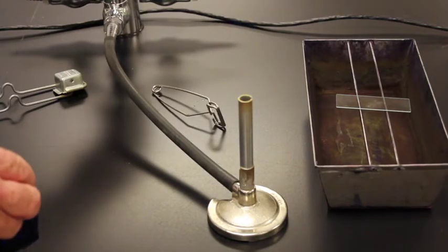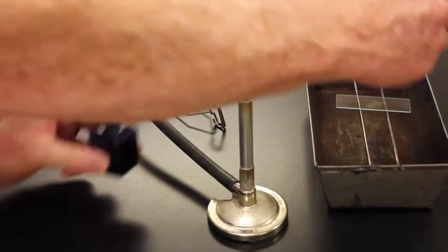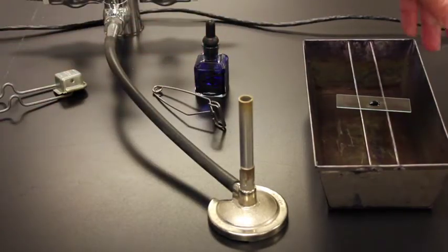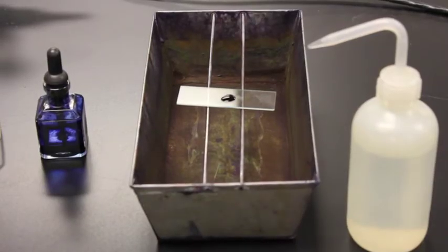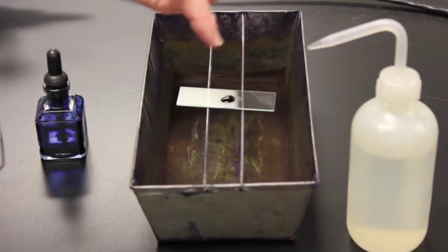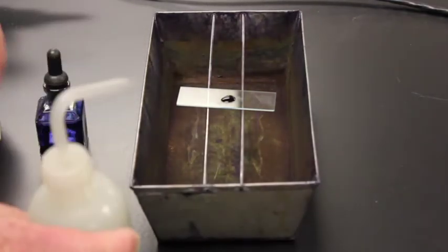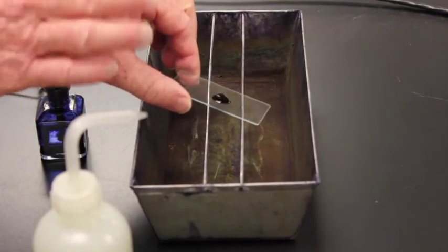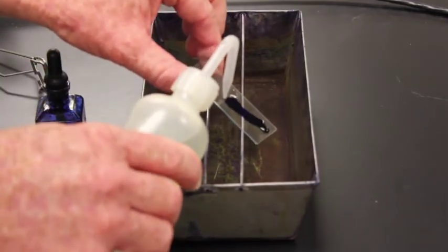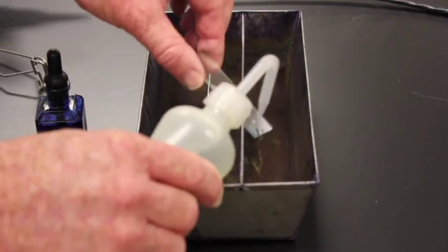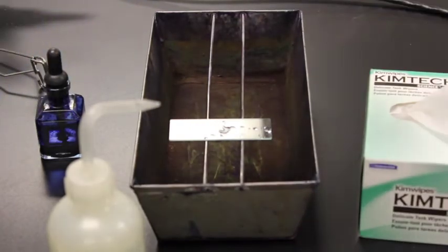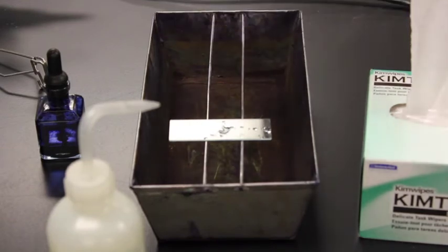After it's on the staining tray, then I'm going to turn off my Bunsen burner. I'm going to add methylene blue. So we'll put methylene blue on top of this stain. And then we will leave that methylene blue there for one minute. Now the next step in staining is simply washing it off. So we put our slide here, put our stain. It's been one minute. So I'm just going to take my wash bottle. I don't really like the clips because they're a little bit cumbersome. I personally like to just grab the slide if you have gloves on. That's a lot better because then you're not going to stain your fingers or anything. So definitely wear gloves doing this. And then we'll just go ahead and wash that off. Then the final step is simply just to take some Kimwipes and blot it off. So for Kimwipes, here's our Kimwipes. Just take a Kimwipe, we'll blot off the top, blot off the bottom and put it on the microscope.